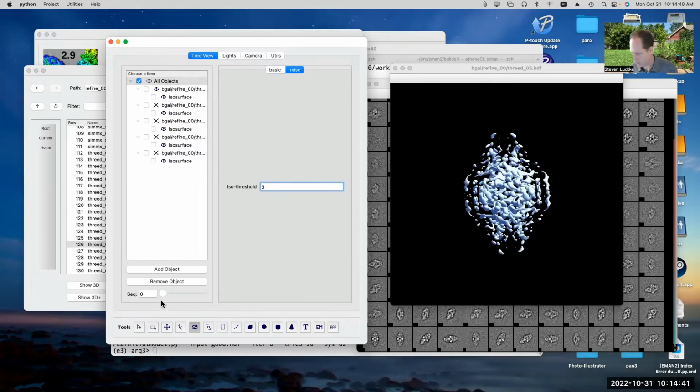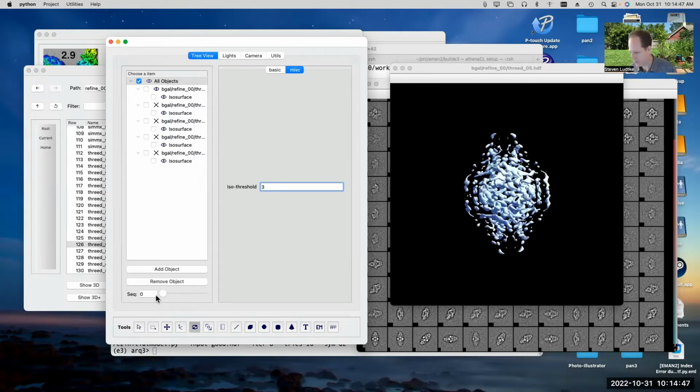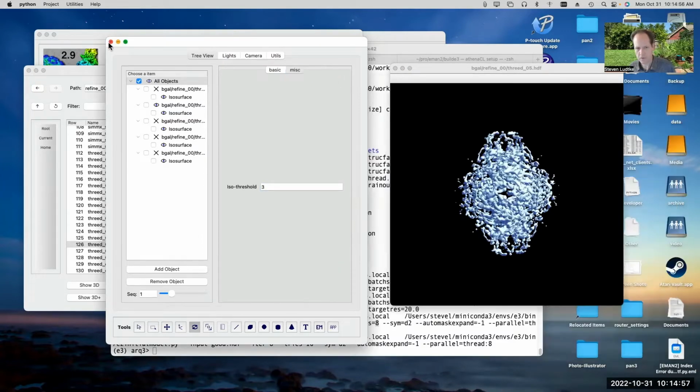And now if I go through them sequentially, you can see there's the first iteration, second iteration, third iteration, fourth. You can see even the first iteration already started with a pretty decent, high resolution looking map. If we want to evaluate that a little bit, we can look at the FSC curves.